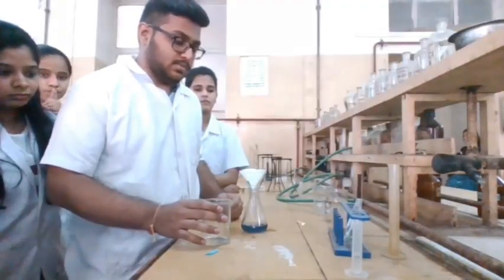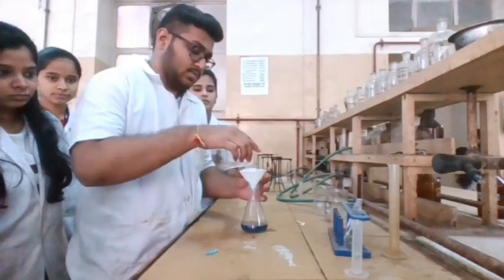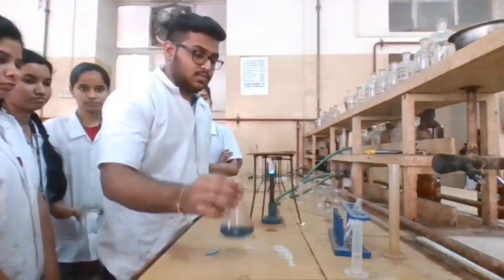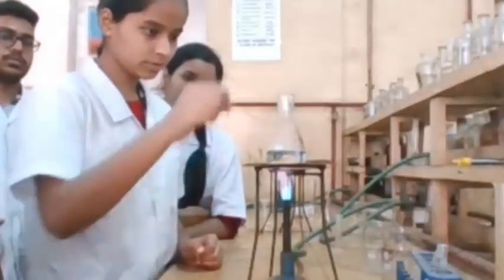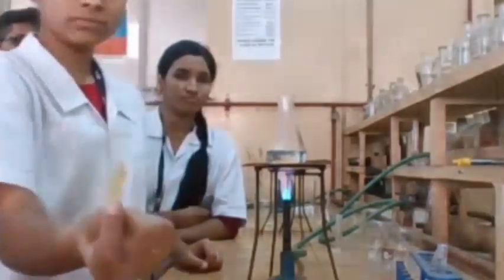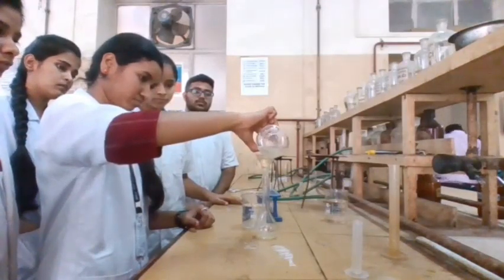Wash the filter paper with 20 ml hot distilled water. Boil the filtrate until complete evolution of NH3 takes place; test with turmeric paper — it should remain unaffected. Cool the solution to room temperature and dilute to exactly 100 ml in a volumetric flask using distilled water.